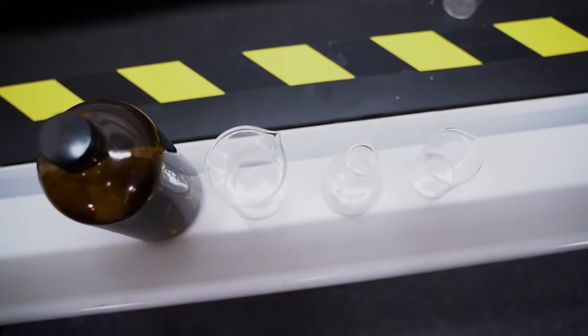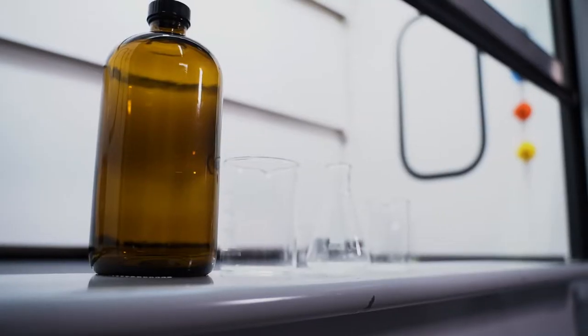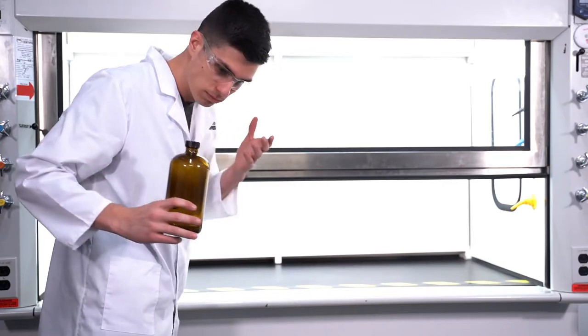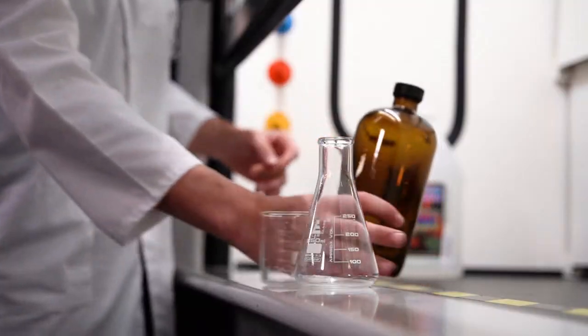Do not use the front airfoil as a holding shelf to set flasks, beakers, or bottles on. They can easily be knocked off, spilt, and broken, thus creating yet another safety issue.